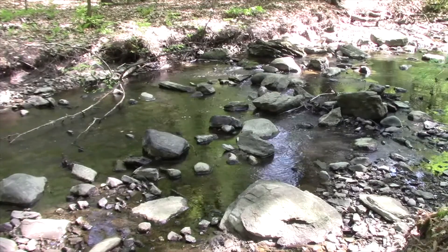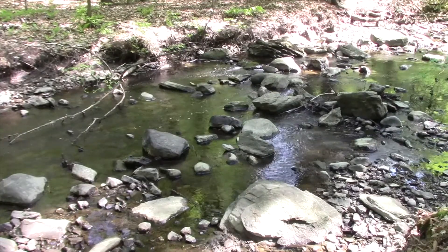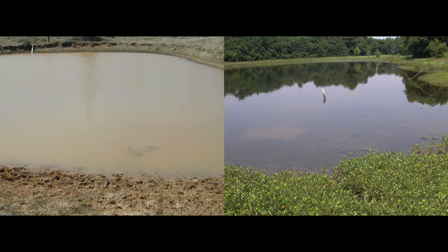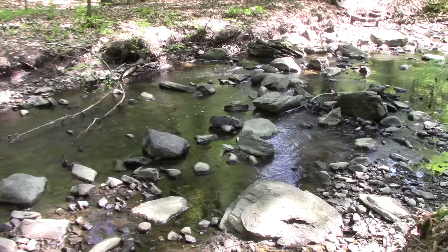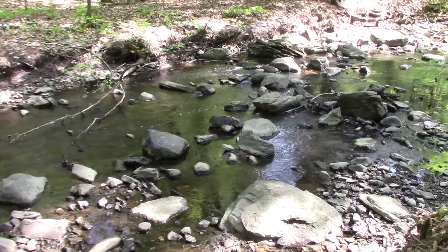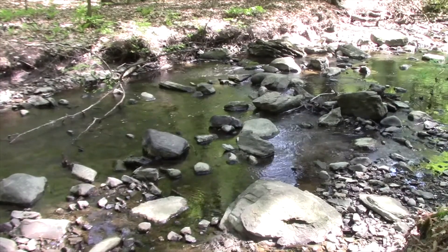Turbidity is the measurement of the relative clarity of water. Turbid water is caused by suspended and colloidal matter such as clay, silt, organic and inorganic matter, and microscopic organisms. Turbidity should not be confused with color, since darkly colored water can still be clear and not turbid.